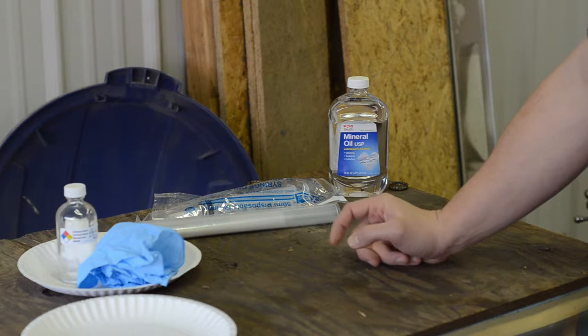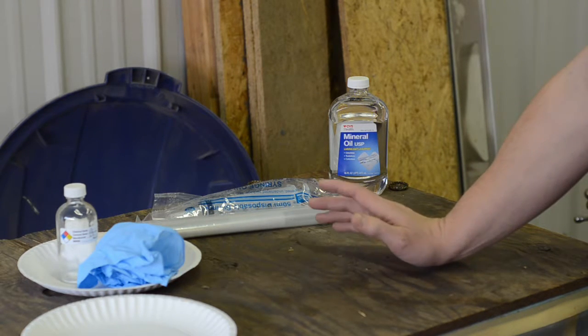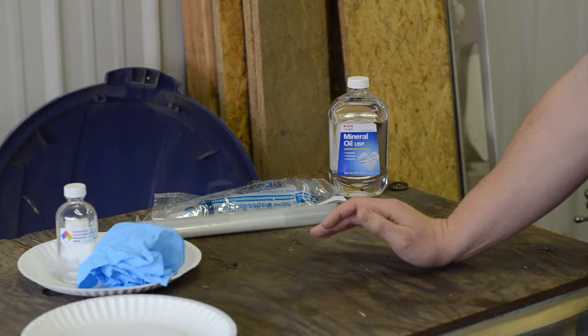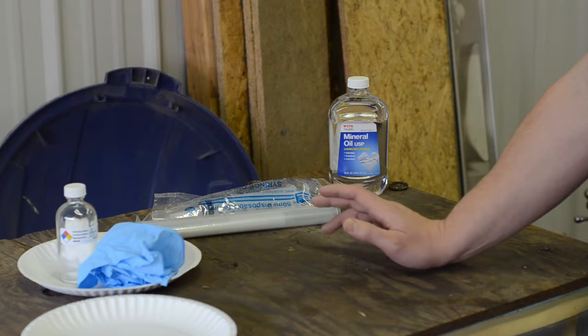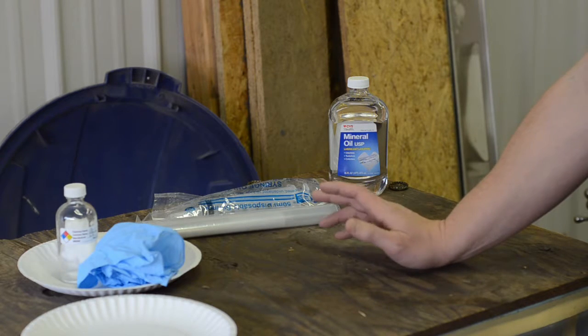Today we're going to be doing something especially amateurish and well outside of my domains, but we're going to store some mercury. So in the process of picking up this machine shop recently, we found a small to medium sized sample of mercury, which for some reason I've decided I want to keep. I guess by home lab standards it's probably a pretty large sample of mercury, but that's beside the point.